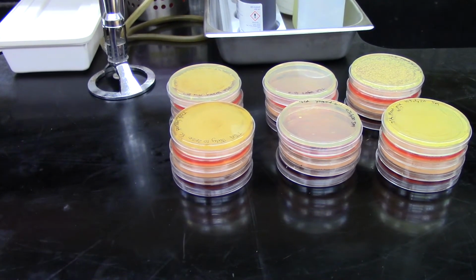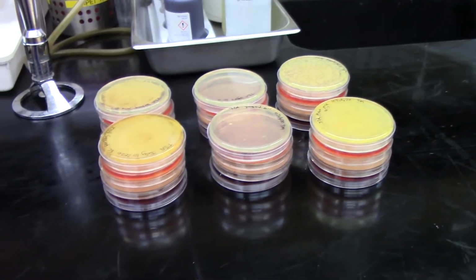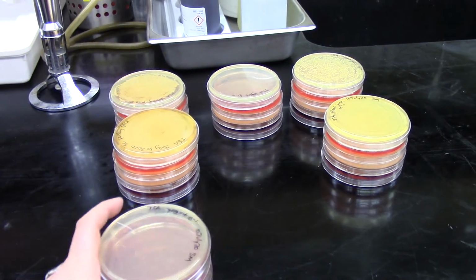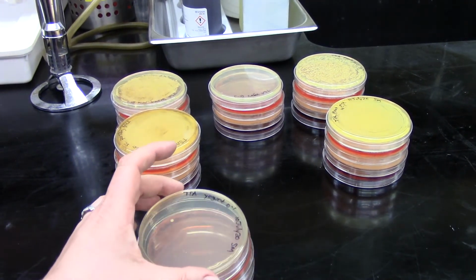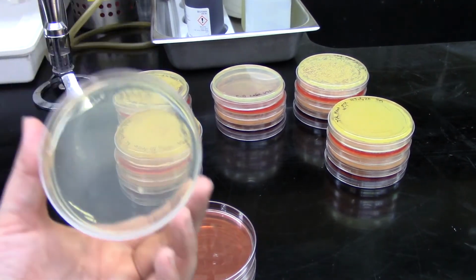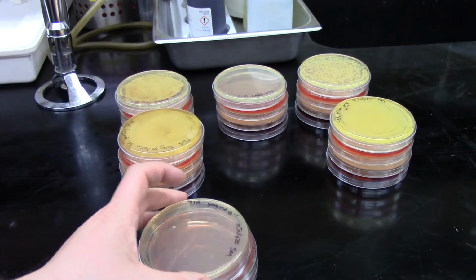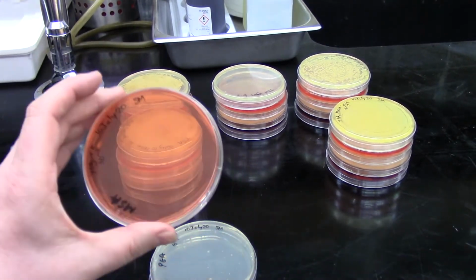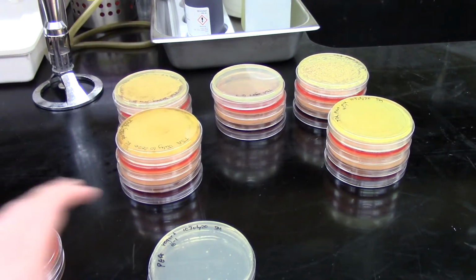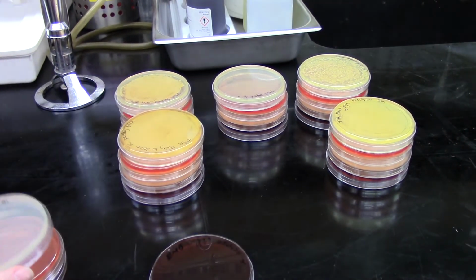Now, here's the fun part. Let's look at our samples, our disgusting food samples. So first off, we had yogurt. And when we just did that single dilution that we showed on camera, we only saw growth of one single colony on TSA. On all of our selective and differential medias, we did not see any growth whatsoever. The only little things there are just bubbles that were in the media.